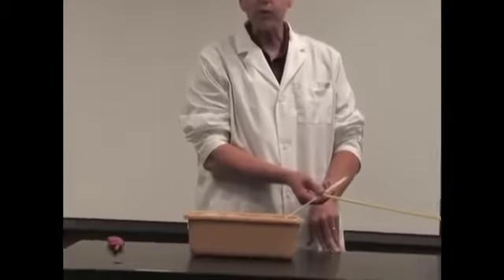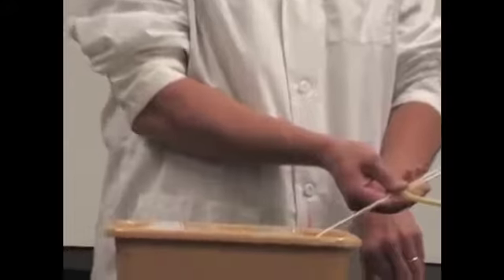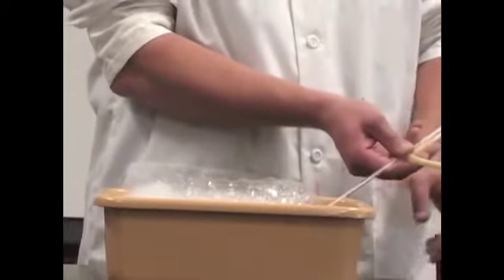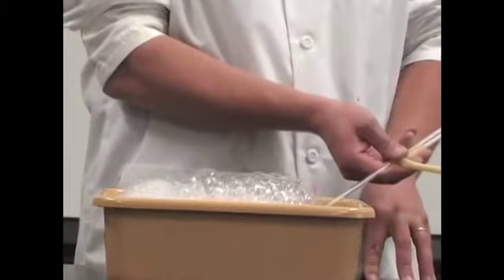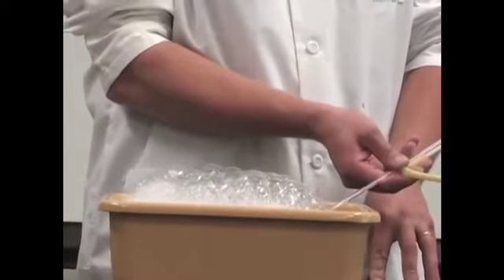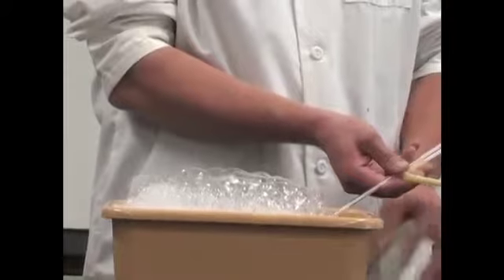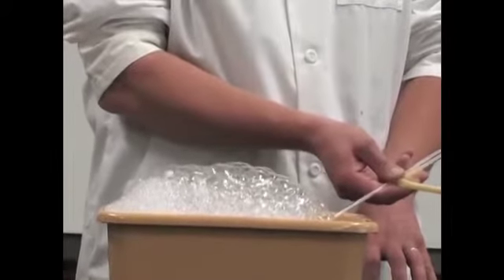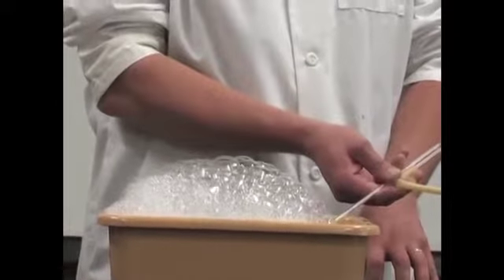When you get to chemistry, you learn a lot about some different types of reactions. And one of the reaction types that you're going to learn about is the combustion reaction. Now, you've probably heard about combustions in automobiles, where you combust gasoline in an engine to produce energy that makes your car go. And your gas furnaces at home actually combust gas to give you heat that heats your homes. Well, today I'm going to demonstrate a combustion reaction right in front of you.